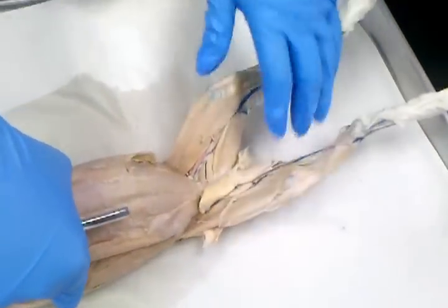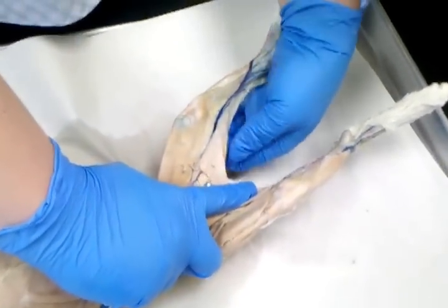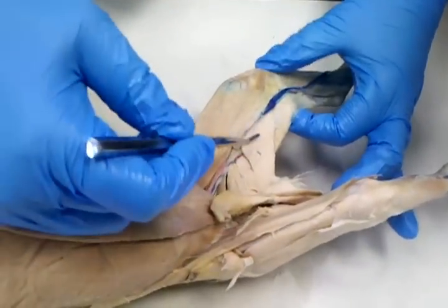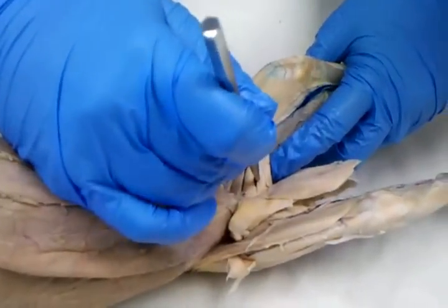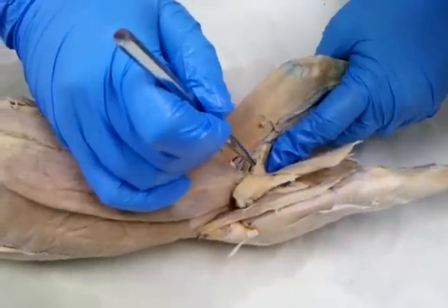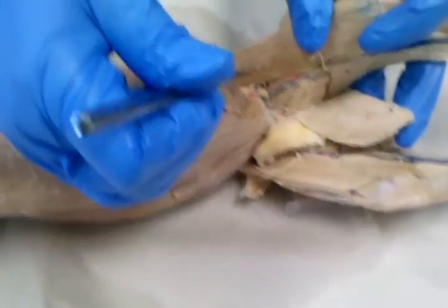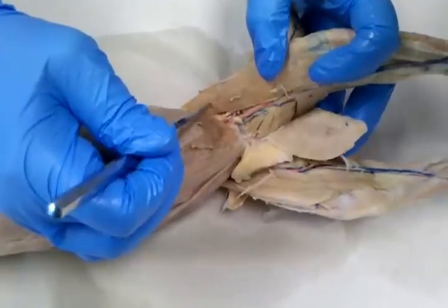All right. Now deep to the gracilis, on the inside of the leg, down here on the very bottom, if I can hold that apart, this right here is semitendinosus, okay? Directly above it, you've got semimembranosus. Between my finger and the probe is adductor femoris, and this one right here is adductor longus, and the small one up the top is pectineus. Okay, now iliopsoas is up in the crook of the hip joint, and it is this muscle right here. So it's in the crook of the hip joint.